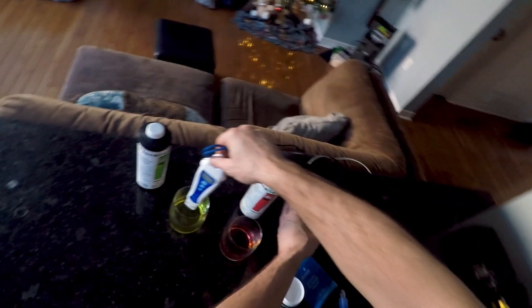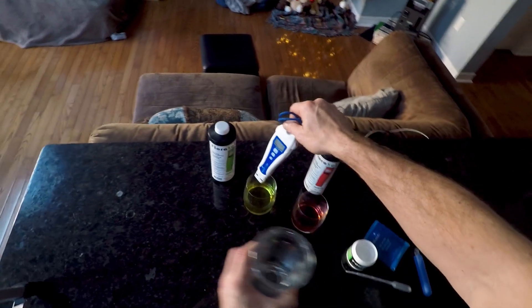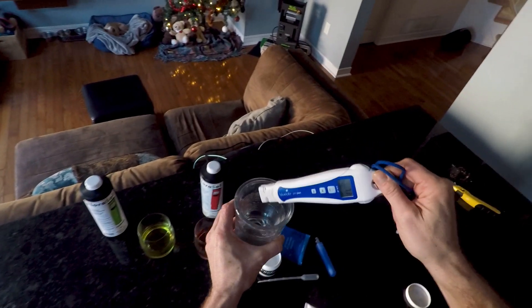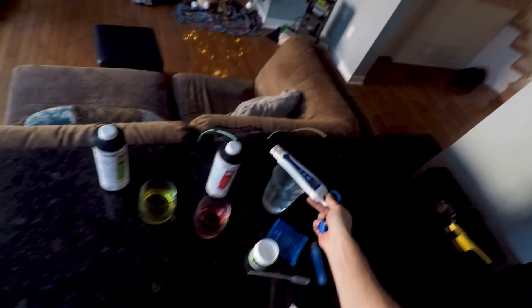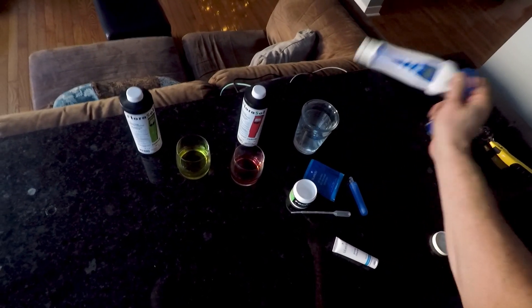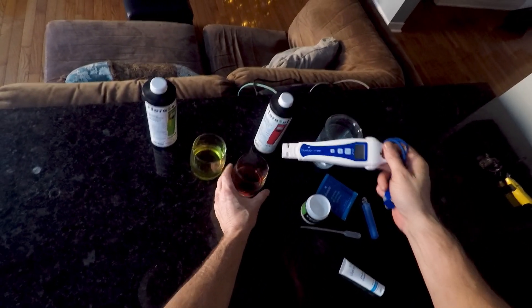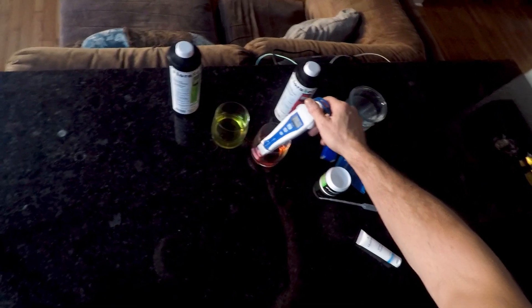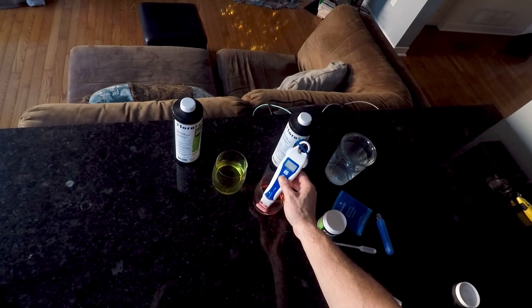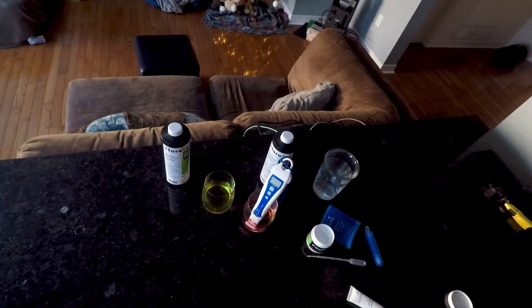So I'm gonna just give that a little rinse in plain water and then we'll stick it right into the 4 solution. And then we're gonna press Cal and release.